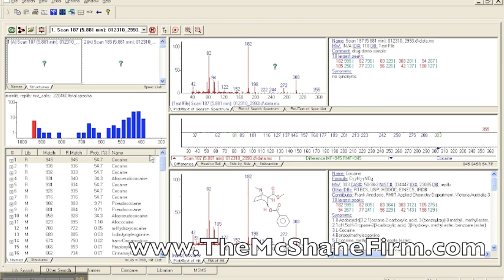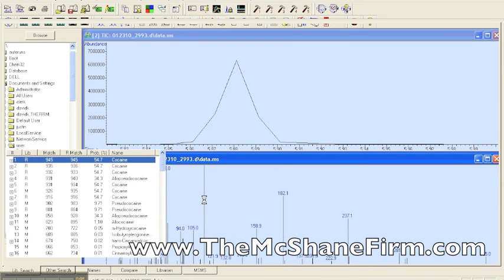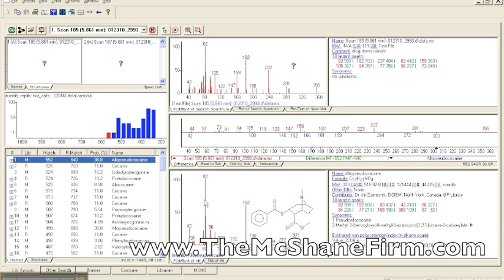So if you remember in our first example, when we went back over here and we clicked on the extreme, it came up with allo-cocaine. And if you notice, allo-pseudo-cocaine, if you notice, the match factors change. Not only is the possibility of getting it wrong and having these different compounds that are there, but the report, in terms of how many matches you make, makes a difference in where you click on the peak.